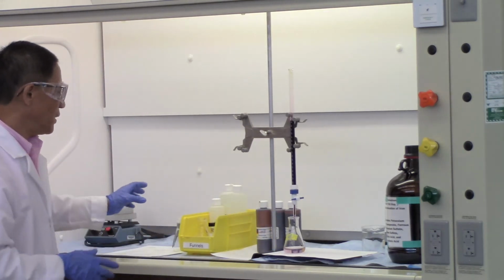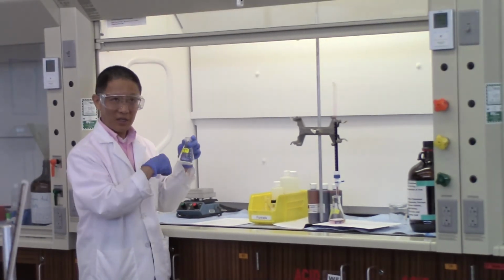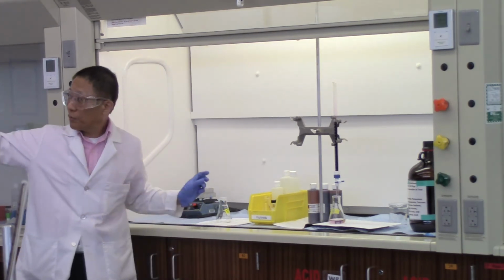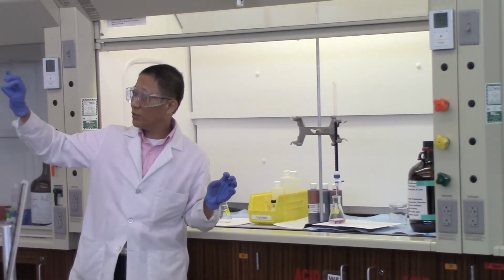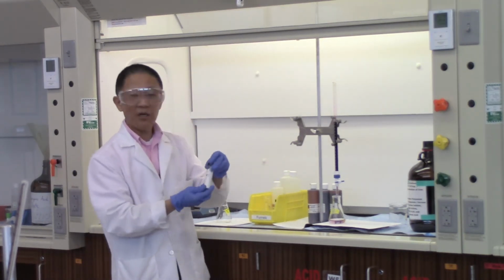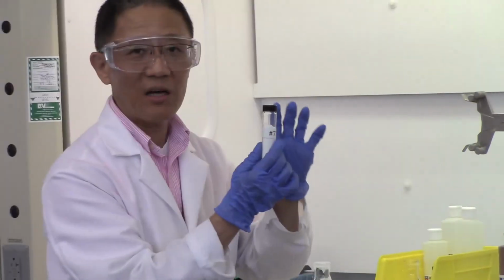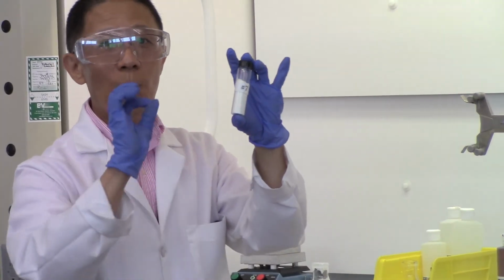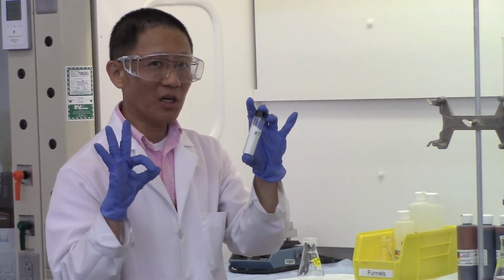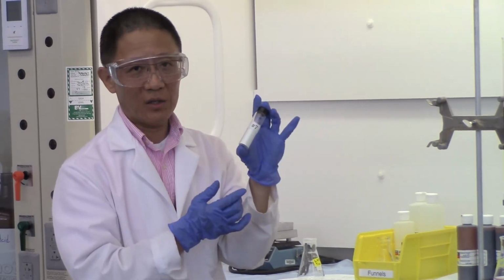Now we need you to repeat this process with the 6.95% iron sample. We need to repeat that 2 more times. Okay? And then going through A to D to try to figure out the molar concentration. And then we have the unknown sample. Now you can see the unknown sample with a number there. It's Unknown 7, number 7. We want you to use this sample, measure out 3 portions of this sample, repeat the process 3 more times so that you can determine the percentage of iron in this particular sample.